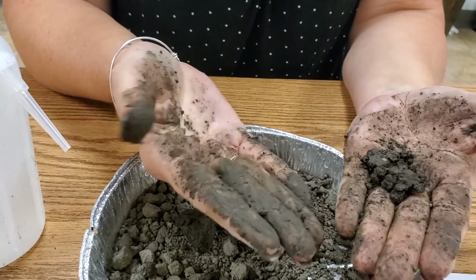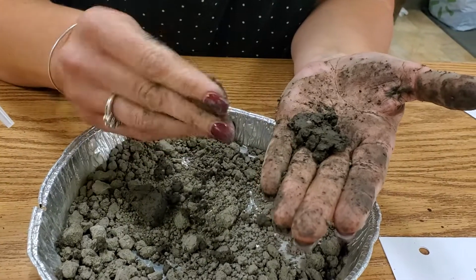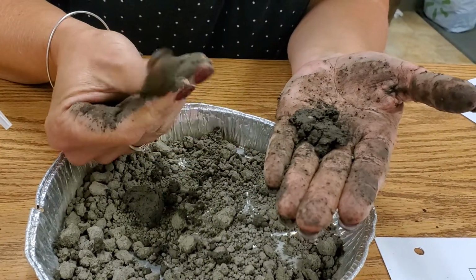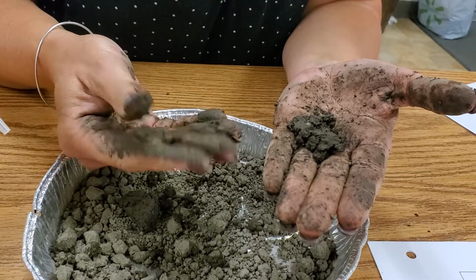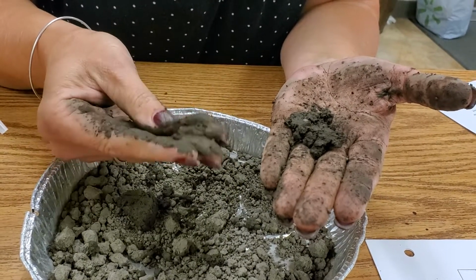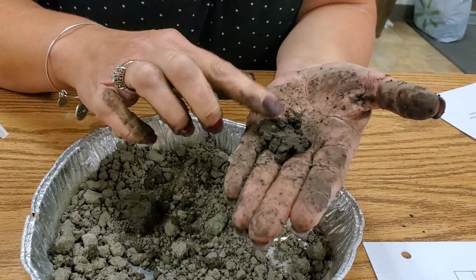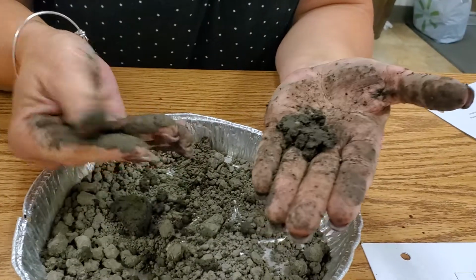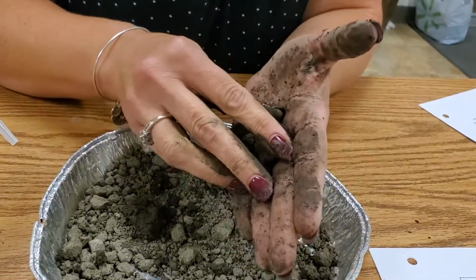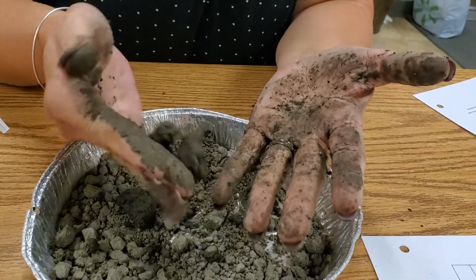It's nice and smooth. If you're able to form a ribbon that's 1 to 2 inches and it has a smooth feel, it's a silty clay loam. Or if it's 1 to 2 inches and it's not gritty and it's not smooth, you have a clay loam. I would definitely call this a silty clay loam because it is smooth. It's definitely very sticky. It's almost technically like a perfect clay, but that gives you an idea of an example that's on there.